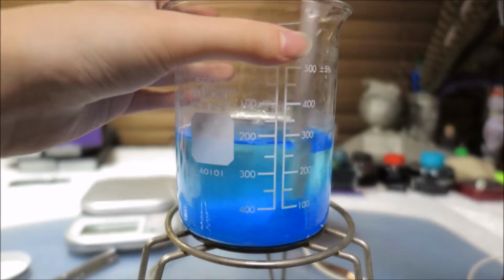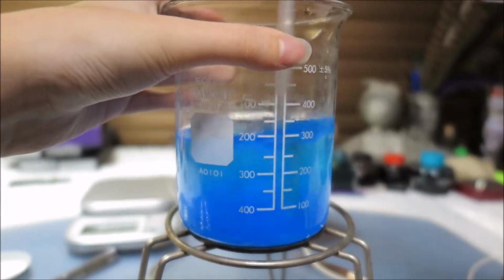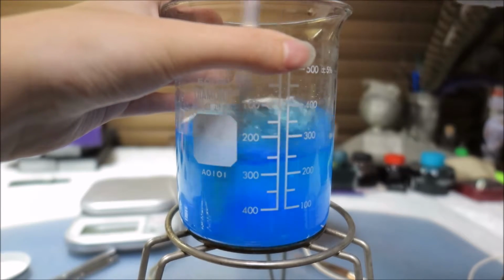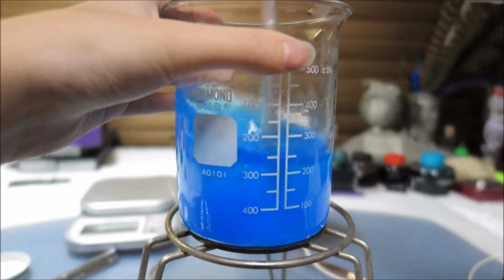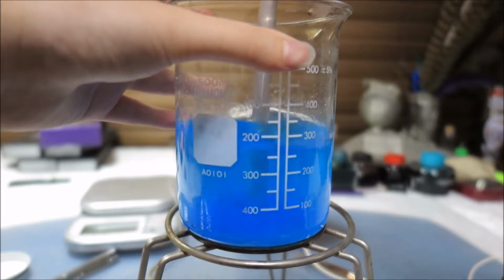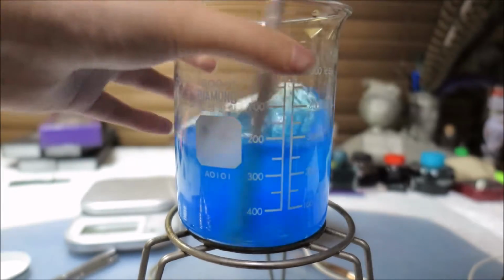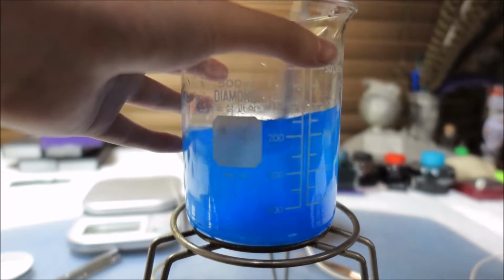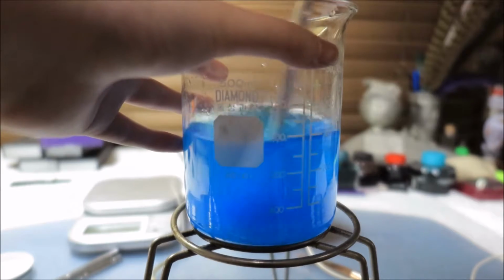The light source is going out of the way. So I'm gonna fast forward. No, I just don't think I need to fast forward this part. No, I think I will fast forward this part. So I'm gonna mix it up until it's completely dissolved.